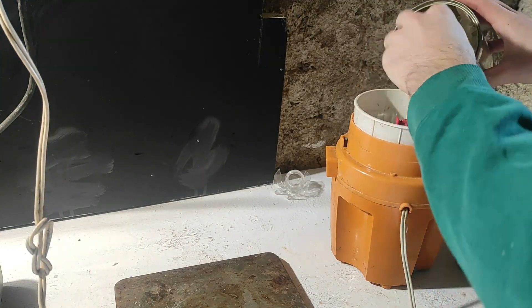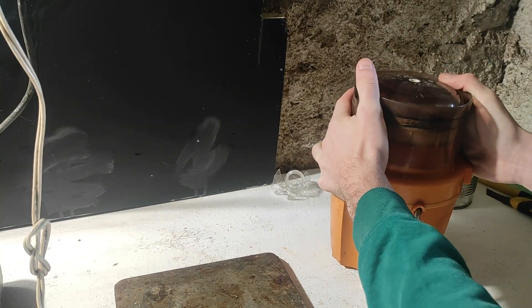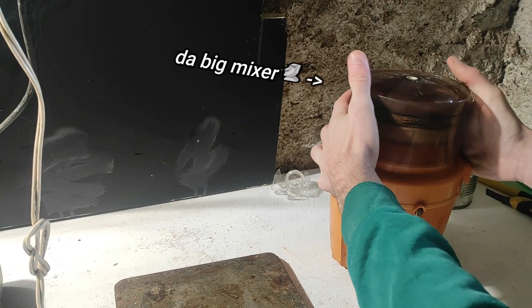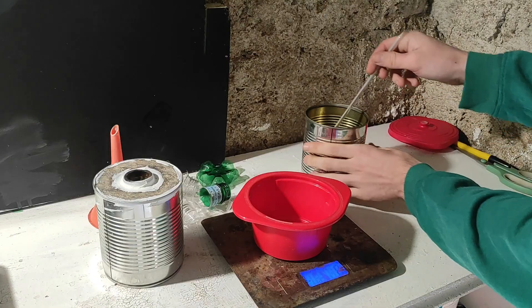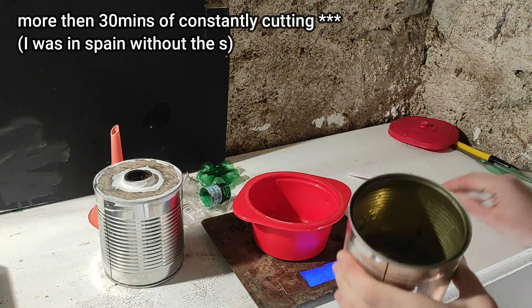So now that I had collected some bottles, I needed to cut them in tiny pieces to make the first reaction faster and easier. I first wanted to grind them with my big mixer, but it seems like it's broken, so I had to cut everything using scissors. And it took a long time!